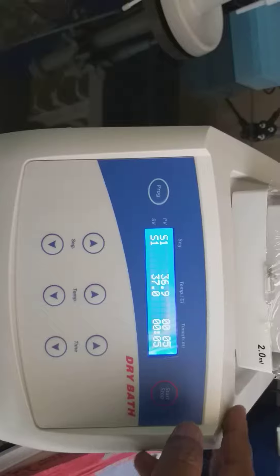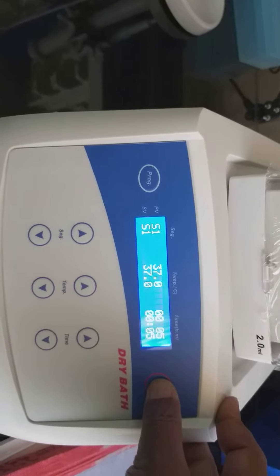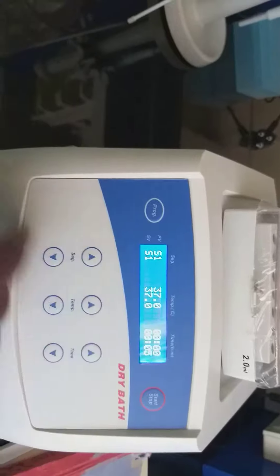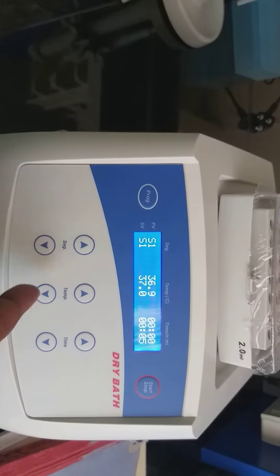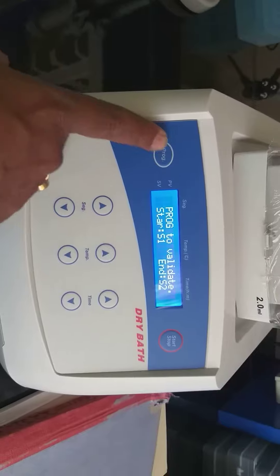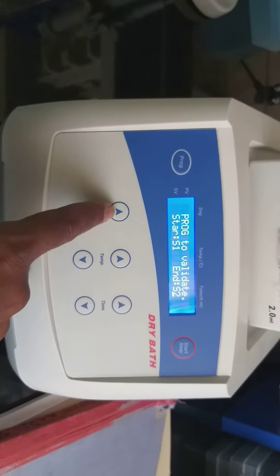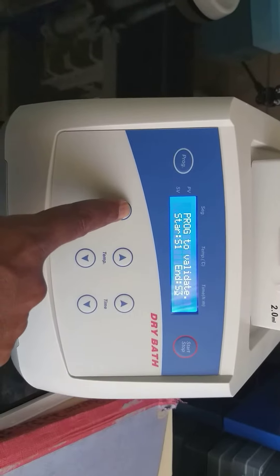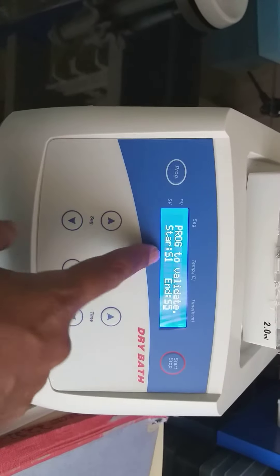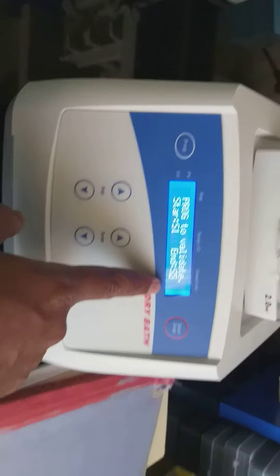In between if you want to stop, you can hold the stop button — continuous, then stop, then stop. If you want to run multiple programs from starting to end, just press S1 to S2. If you want S3, S4, S5 — so on S1 to S5 — in between, 5 programs are still there.